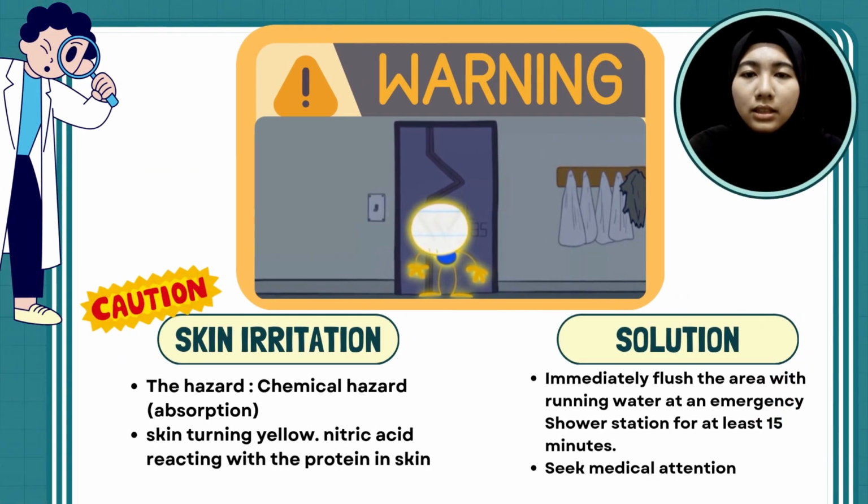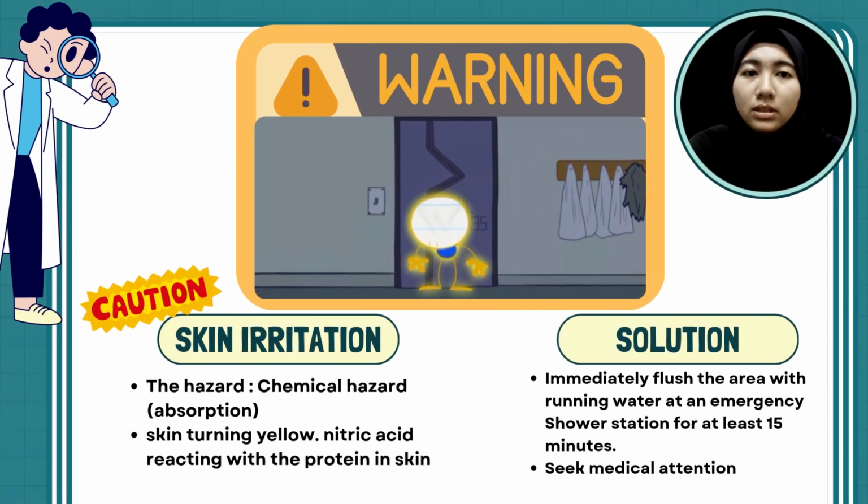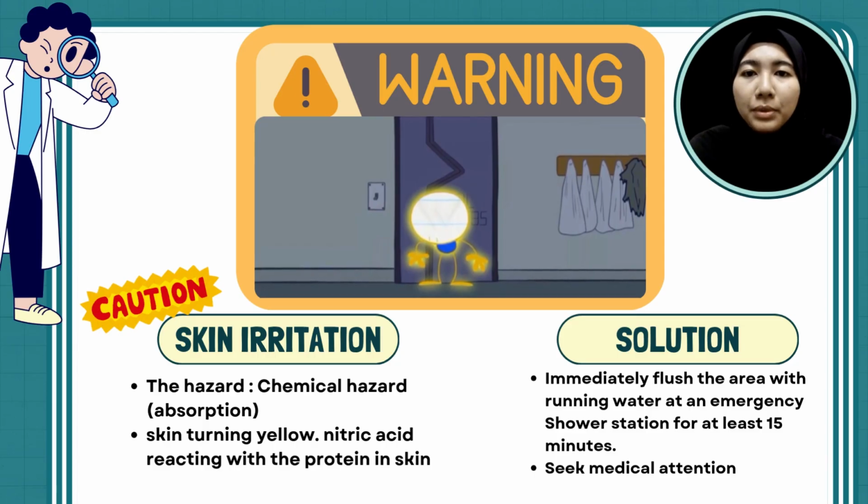Why is his skin turning yellow? This is because the skin comes into contact with nitric acid, which is a highly corrosive chemical. This is a chemical hazard.